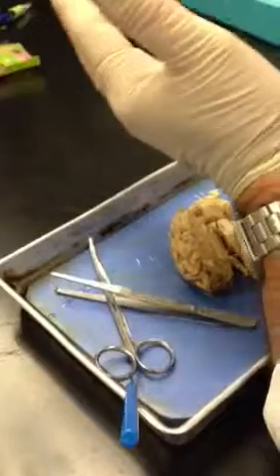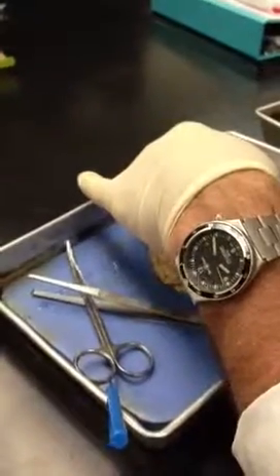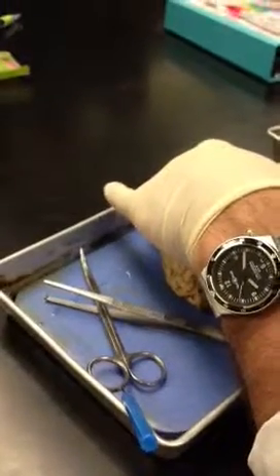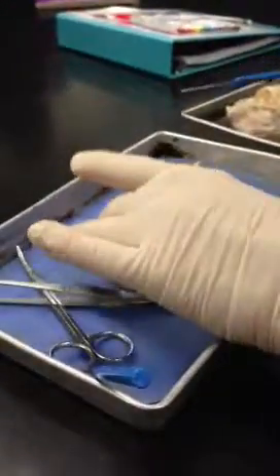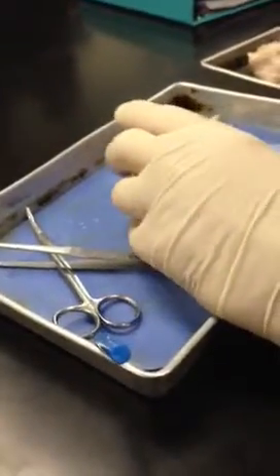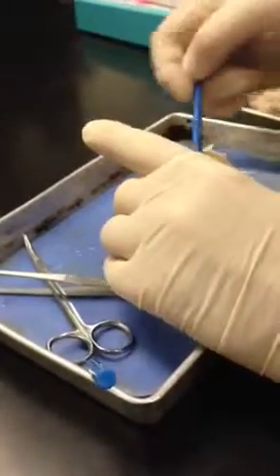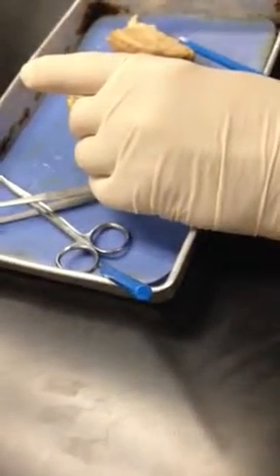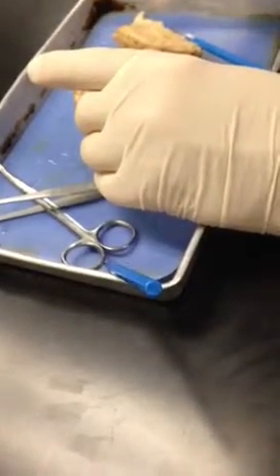So it's a little difficult to say, well, what's that? It's the thalamus. Oh, no, that's wrong. That's the third ventricle. No, it's not. It's the thalamus. The space formed between the walls of the thalamus was the third ventricle. There is a way to demonstrate that. I'll do it one of these nights, where instead of cutting the brain this way, you cut it like this way. And so the thalamus, or the ventricles, kind of appear sequentially, and you can see the third ventricle pretty easily that way.